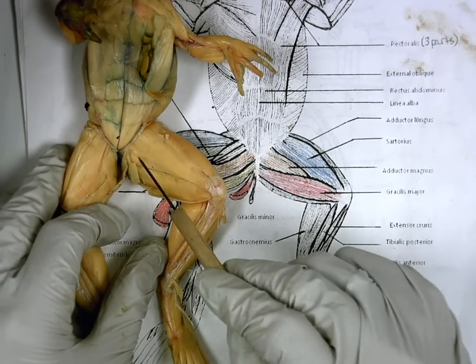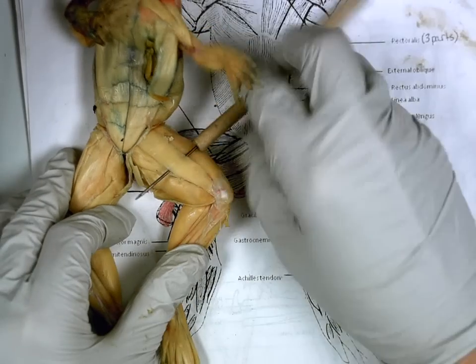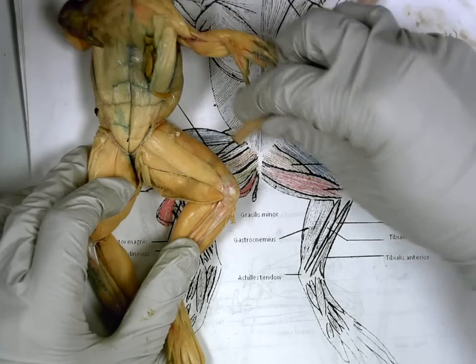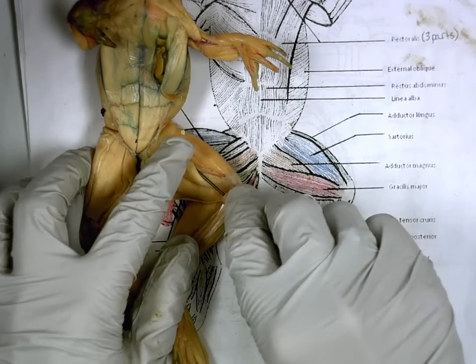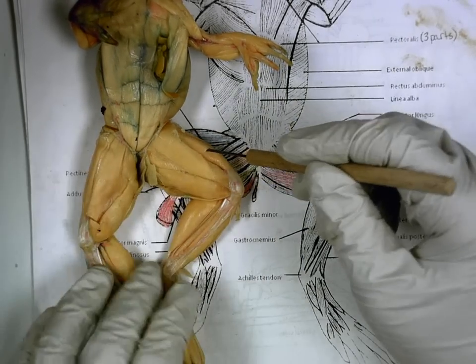Triangular one right here? Adductor magnus. You can see it more clearly when I pull up this one. You can see the triangle right there. Who is this skinny one across the top? Sartorius. And sartorius is covering which big top muscle? Adductor longus.